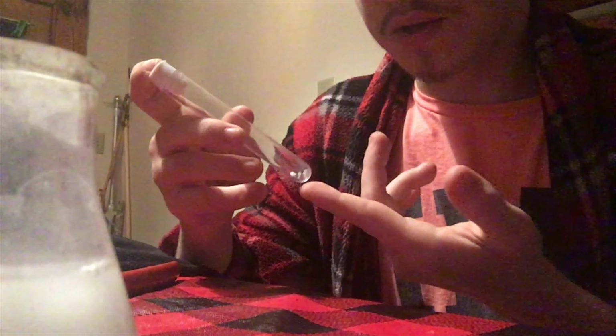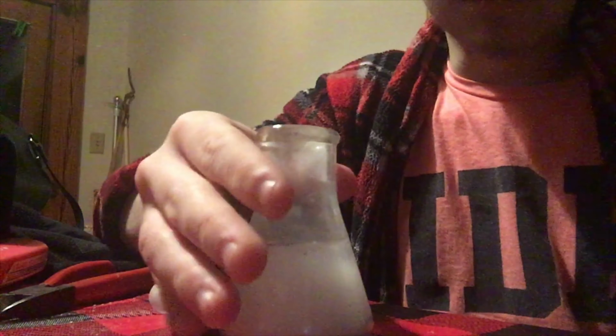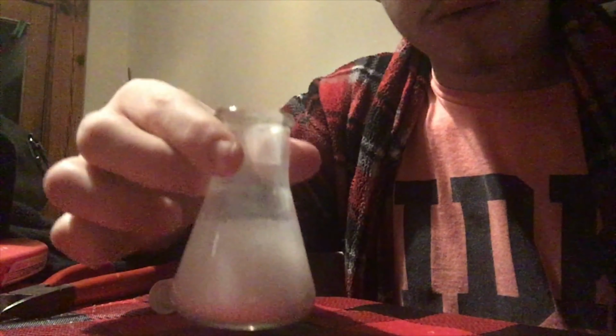Okay, no, the scraps don't react. These scraps are basically calcium carbonate or chalk, because there's carbon dioxide in the air, and that reacts with the calcium. At first, it'll produce the oxide layer, which was kind of quick, but yeah, that is calcium reacting with water.